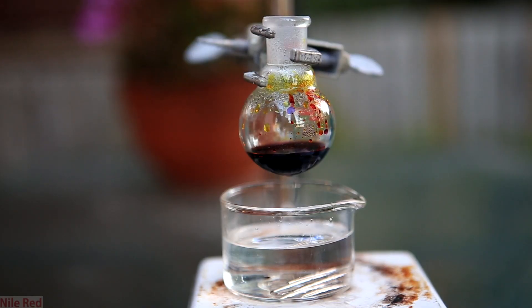After the 30 minutes is up, it's removed from the oil bath and allowed to cool to room temperature. At this point you can do two things. If you don't want to isolate the fluorescein, you can simply dissolve this crude product in some sodium hydroxide solution. This would give you a nice stock solution that you can start playing with immediately. This is what is done in most of the videos I've seen online, but I actually wanted to isolate the fluorescein itself, and to do this we're going to need to do a little bit of a workup.